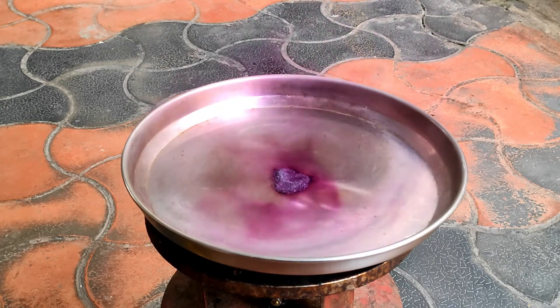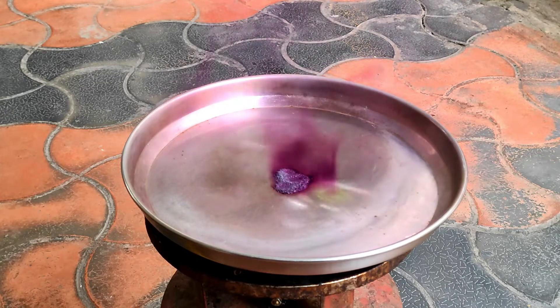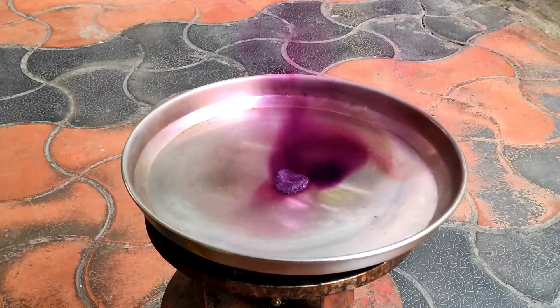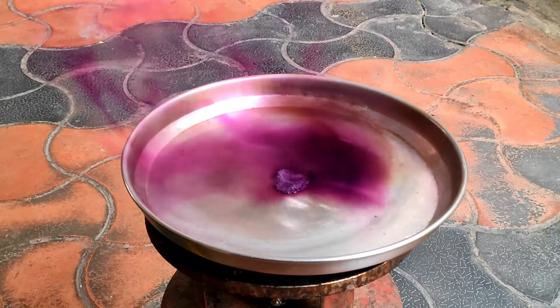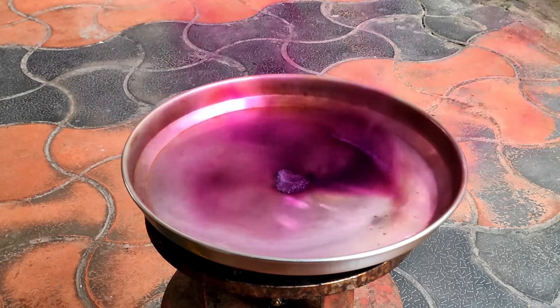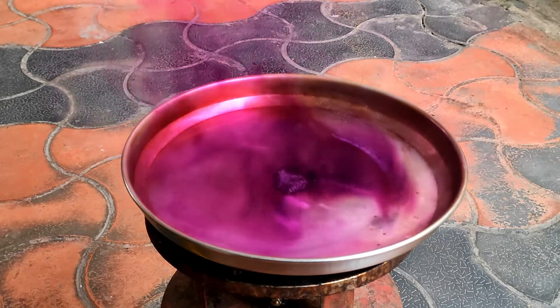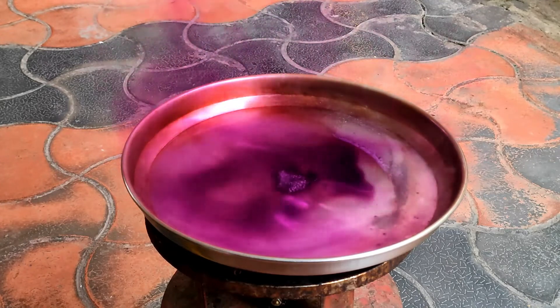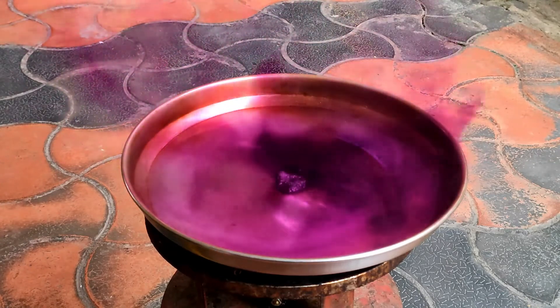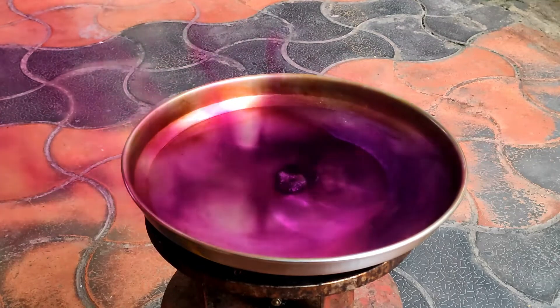As you can see, the iodine starts subliming — that is, iodine is changing from solid to gaseous state. Sublimation is a conversion of a substance from the solid to the gaseous state without passing through the liquid state.